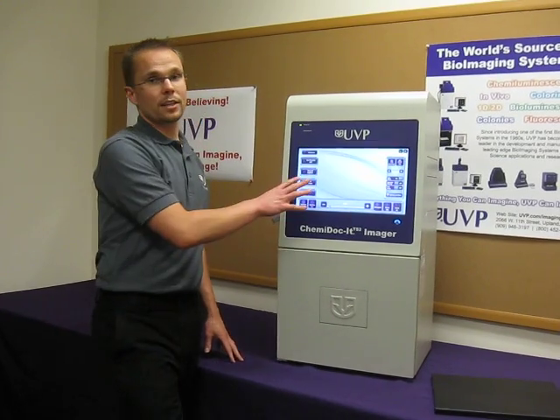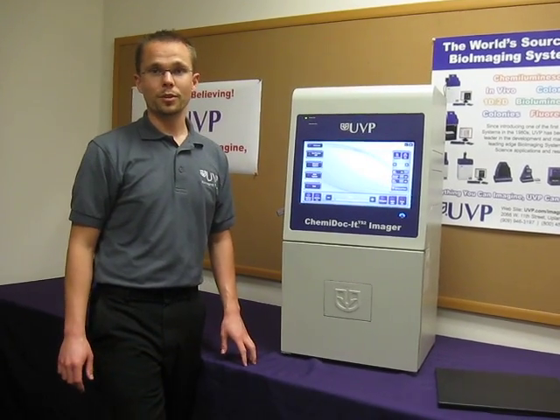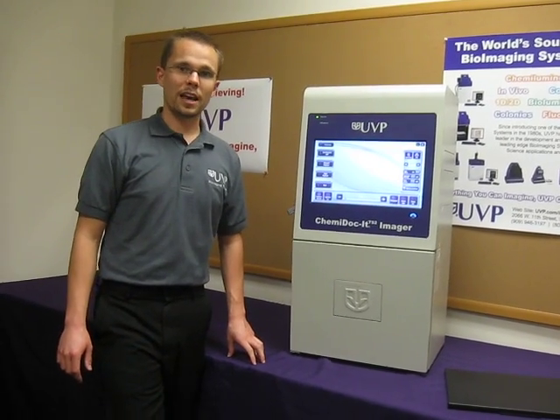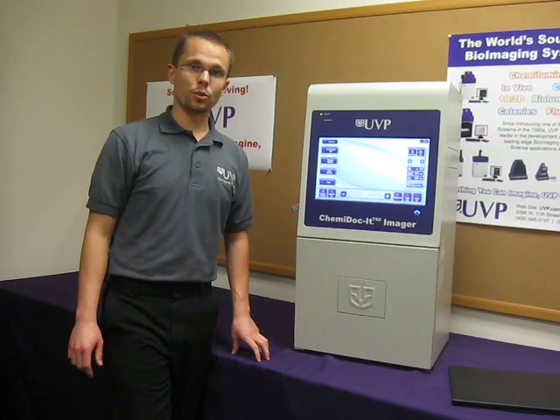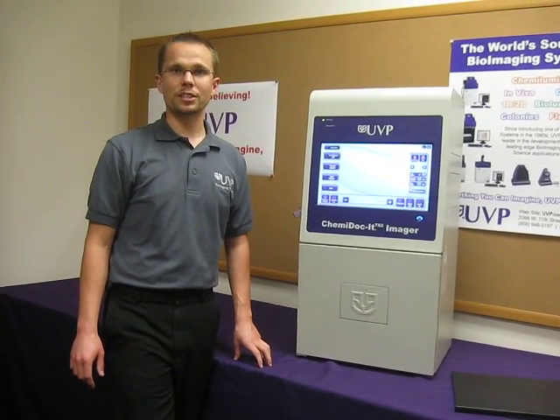This system contains an integrated 15-inch touchscreen computer, as well as a highly sensitive and cooled CCD camera and lens combination.